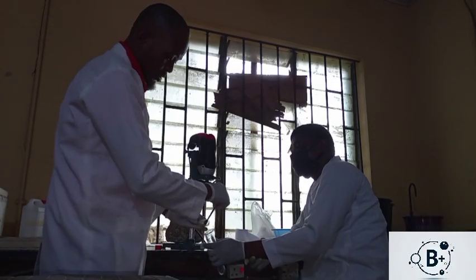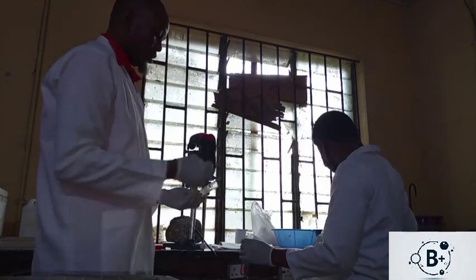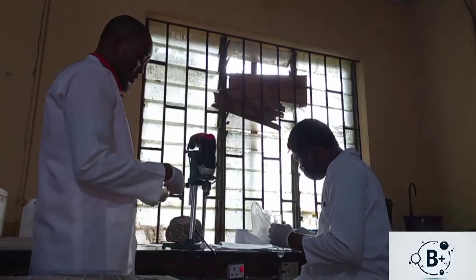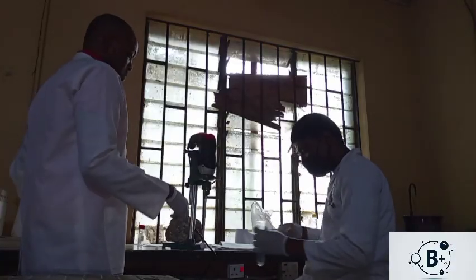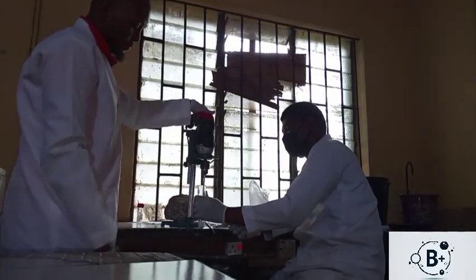So whatever the tissue is, for example, this T here in this particular tissue is for testis. So the testis of the animal model is being homogenized with the homogenizing buffer, which has been calculated and measured accurately, taking the right amount required for it.